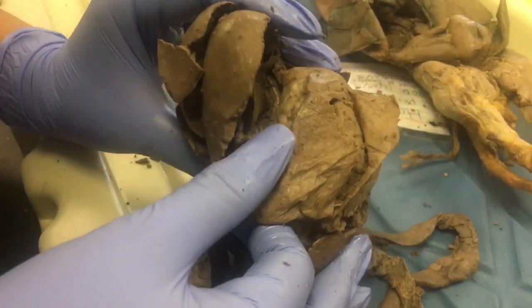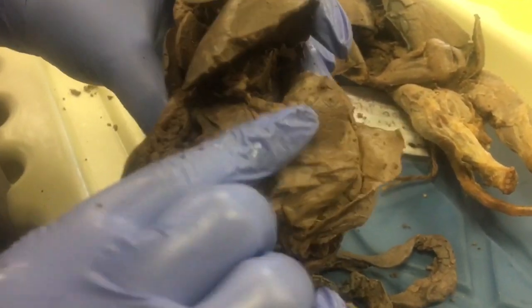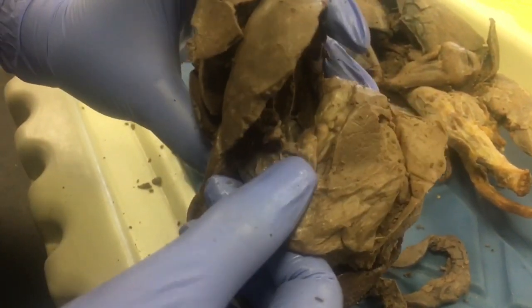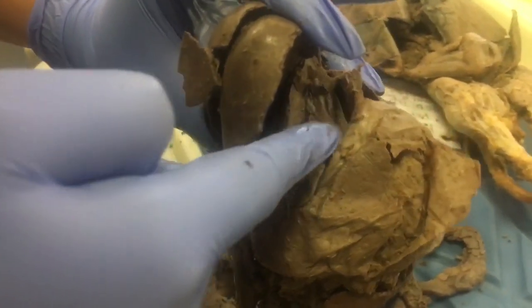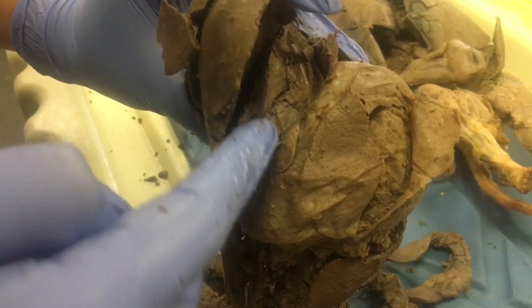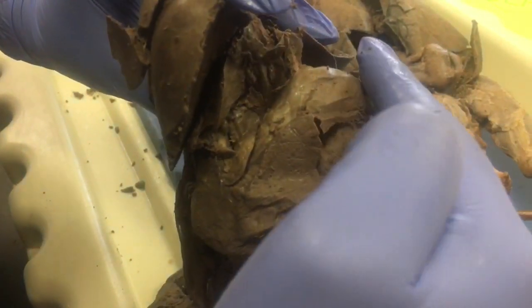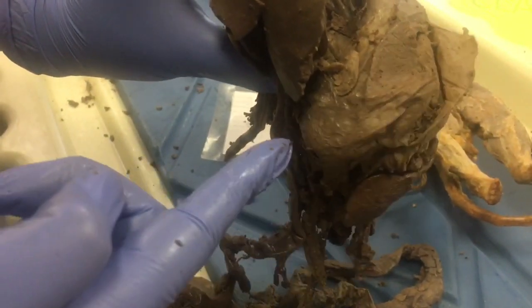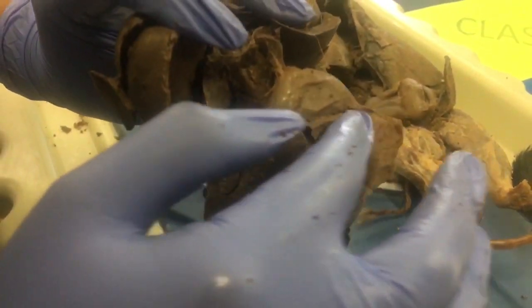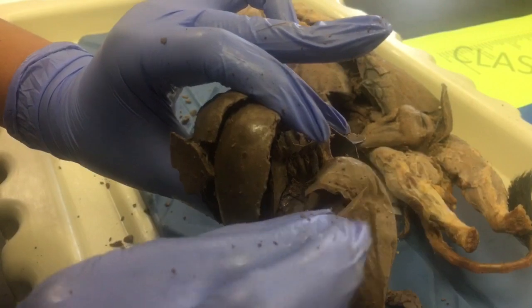Now we are moving on to the stomach, where we start off at the pylorus, which is this harder area right here, and the lesser curvature is this curve right here, and the cardia is this arc right here, and the greater curvature starts from the outside and goes all the way around the stomach, and the fundus is over here in this area, and this is the entire body of the stomach.